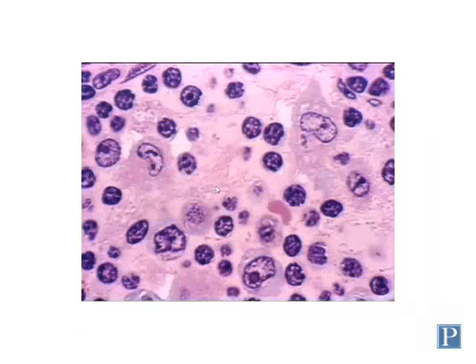Here's a section of tissue that is undergoing some kind of immunological challenge, probably a response to infection of some sort. And you can see there are lots of cells in this tissue here. These are mostly immune cells. There are two major types of cells you can see here. Most of these that have these large, deep basophilic staining nuclei, these are called plasma cells.